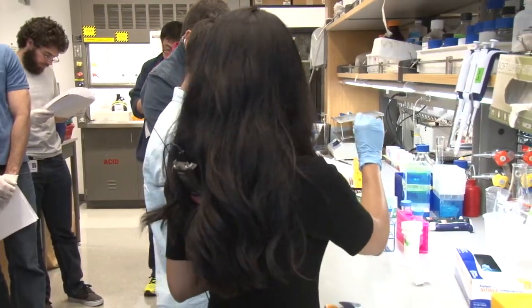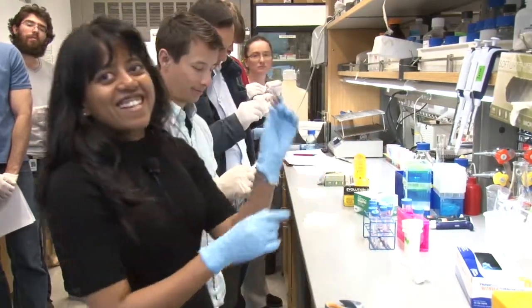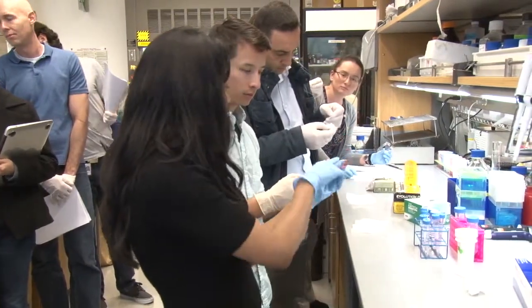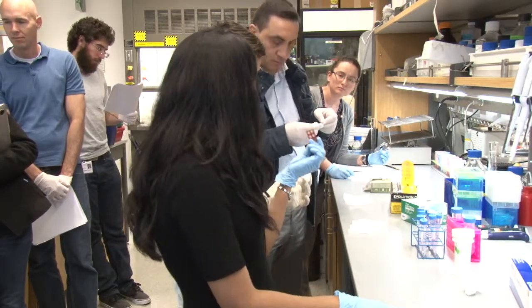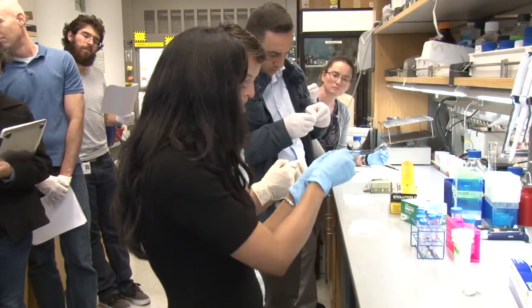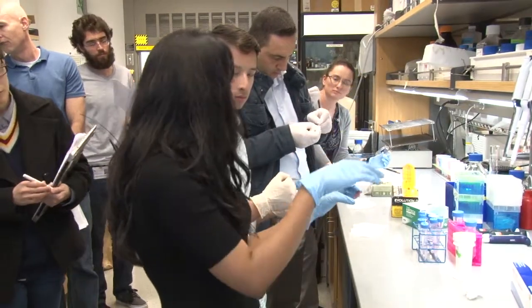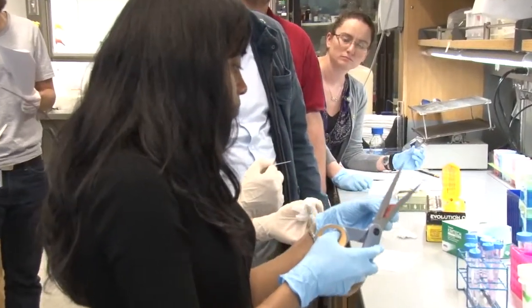So these are the seal chambers — we ordered them from Sigma, and there are multiple vendors who sell this. They typically have eight; I've already cut two out. If you're working with cells, where cells are distributed uniformly on a slide or cover slip, you would just peel this off and stick it onto your slide. But if you're going to work with tissue sections, you can cut it out into individual squares, because you don't really know where your section is going to be on the slide.